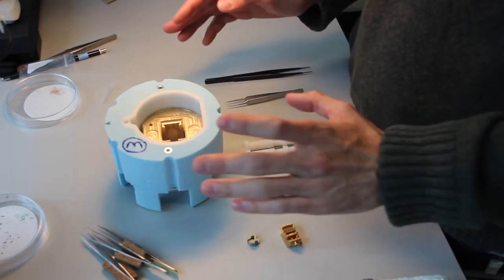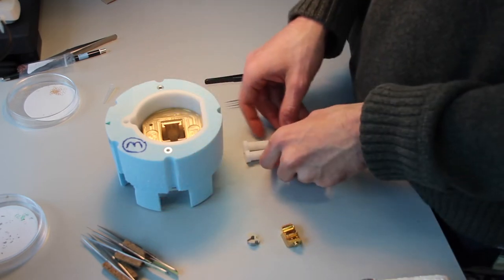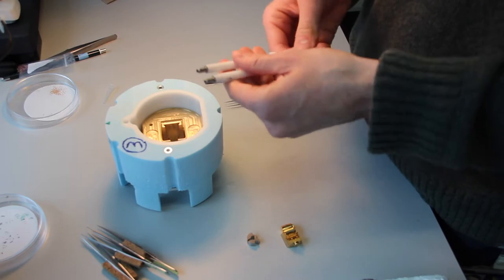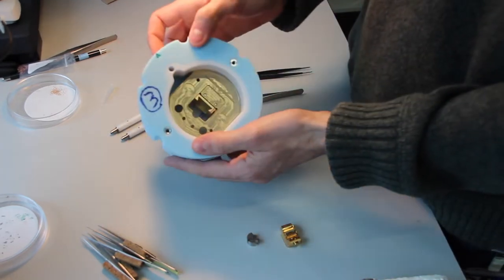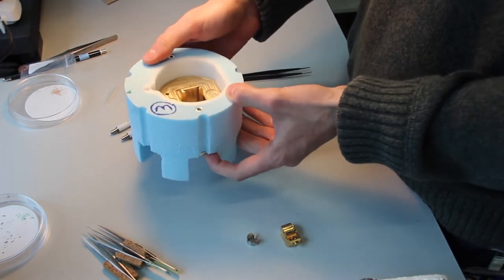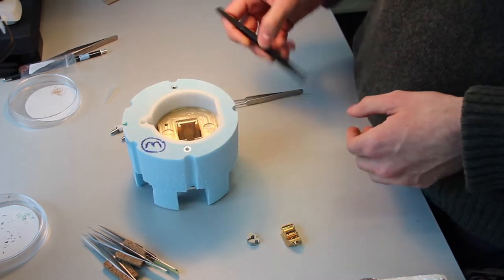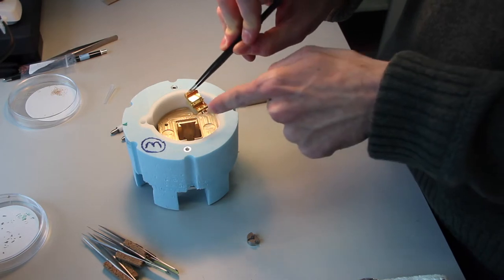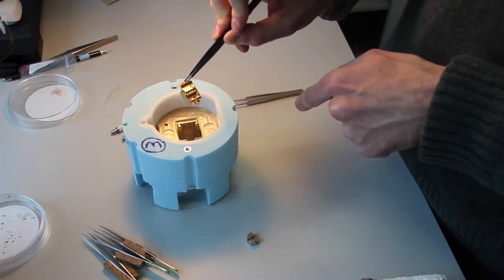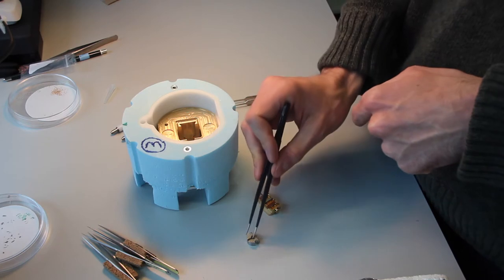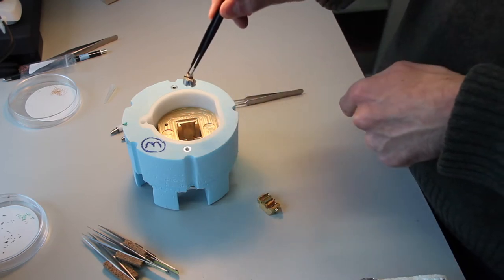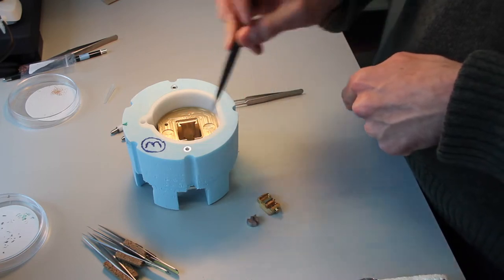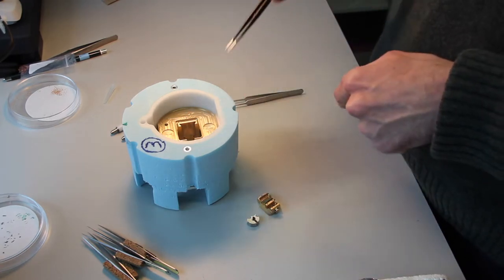These are our tools specific to the FIB SEM loading procedure. We've got our clipping tools loaded and ready to go. We have our cryo transfer box here made by the workshop, our shuttle which will take the two clipped grids, and the clipping station. Now we're going to cool this down to liquid nitrogen temperatures and begin clipping.